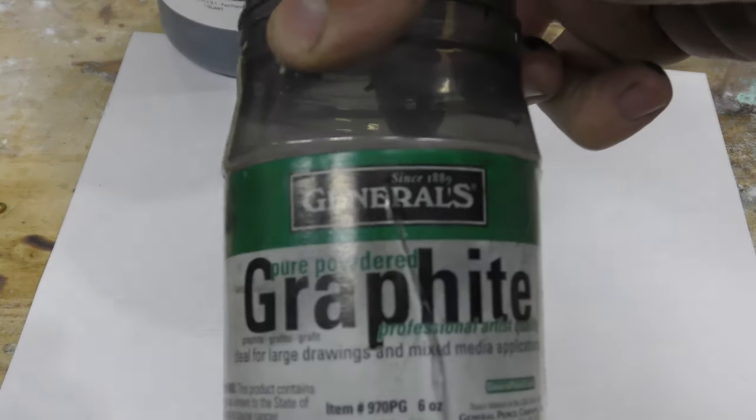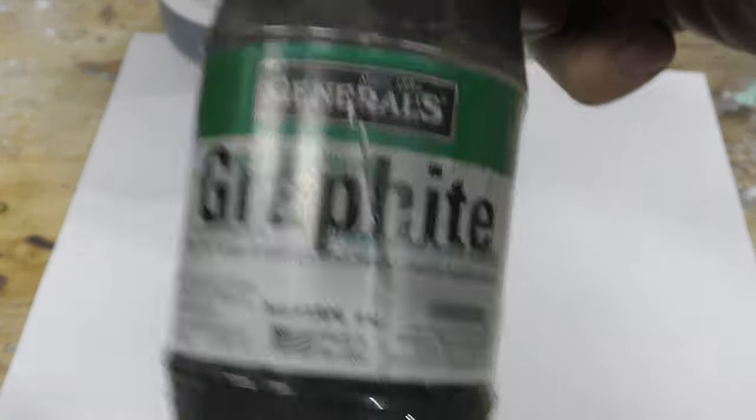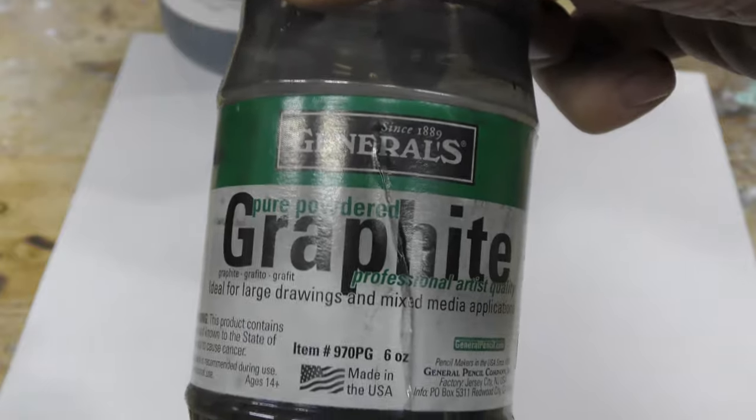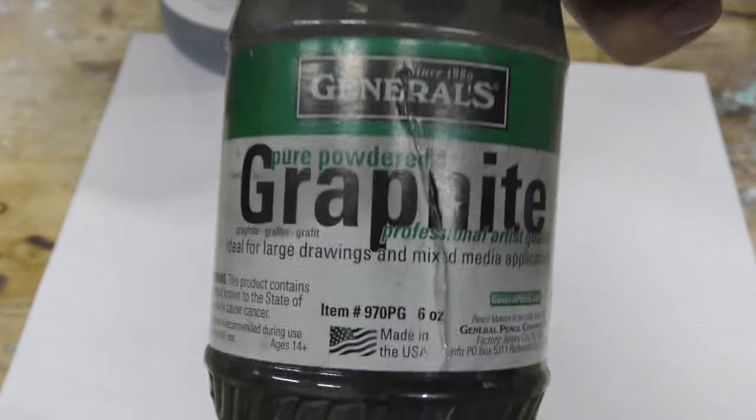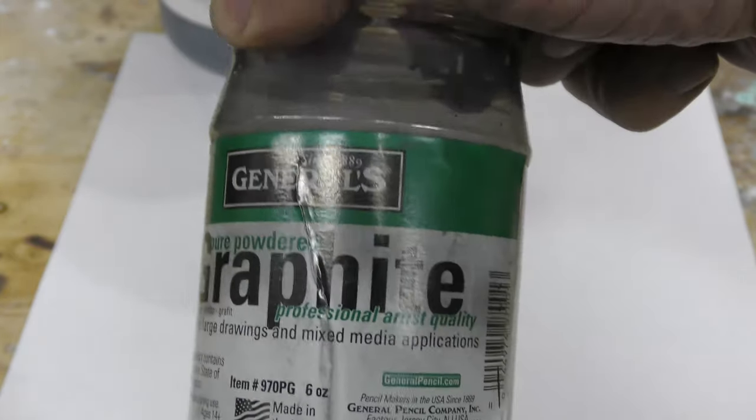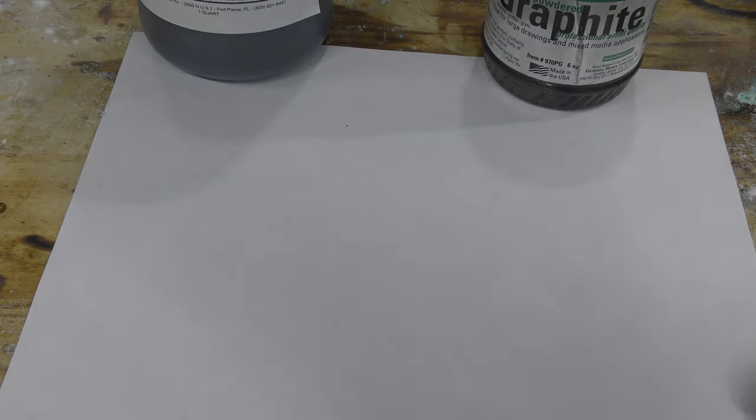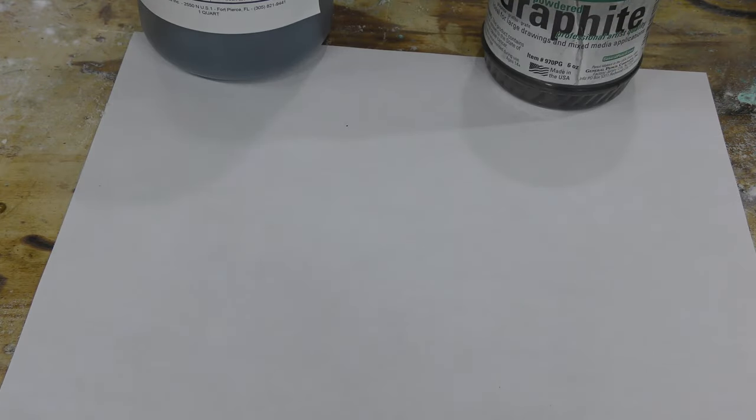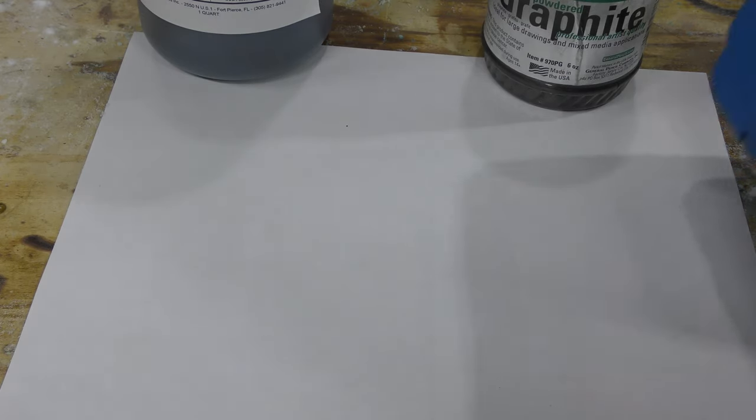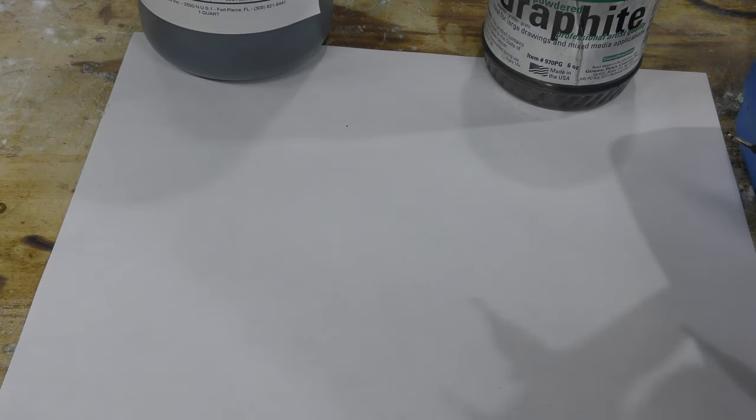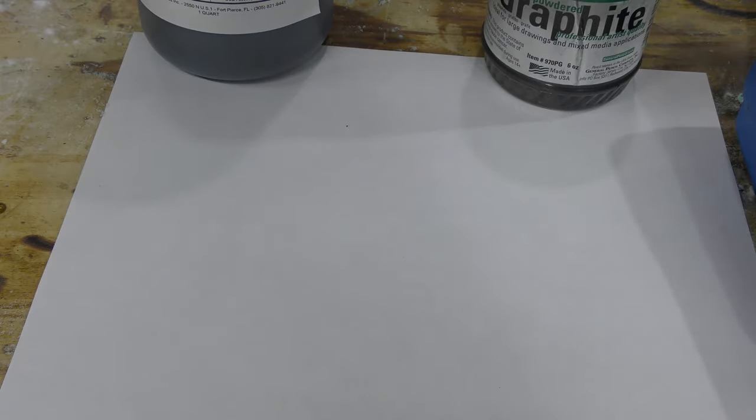So far, General's has the highest conductivity, but the company I think went out of business, so we're kind of left with this or there's a couple other graphites. I did order a couple more to test, but I'm showing you how to test. If you have watched this video and you have tested graphite, please share the results below.